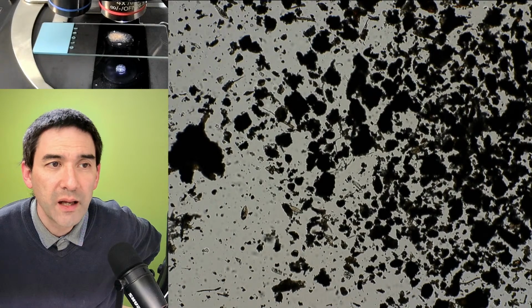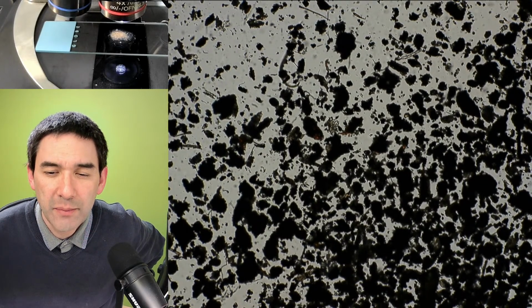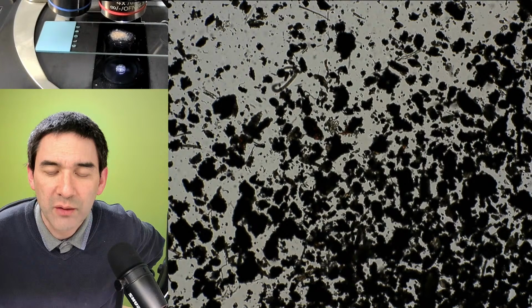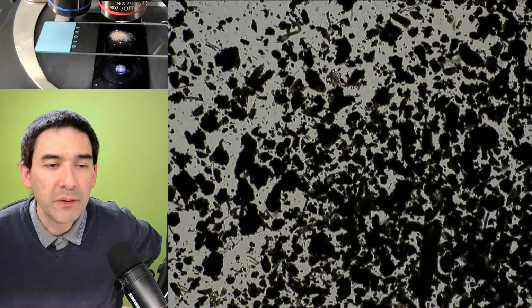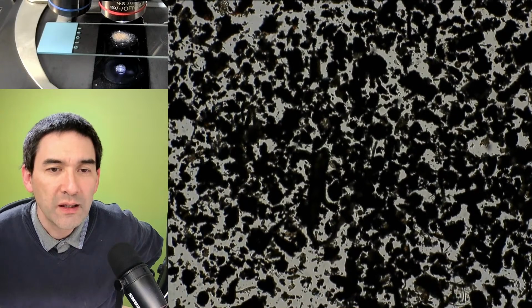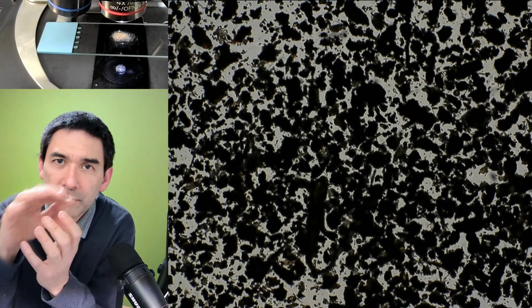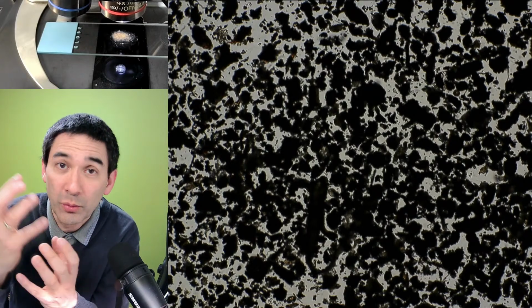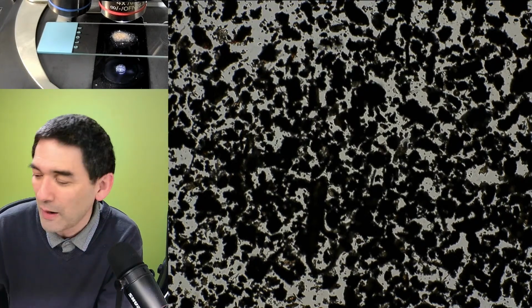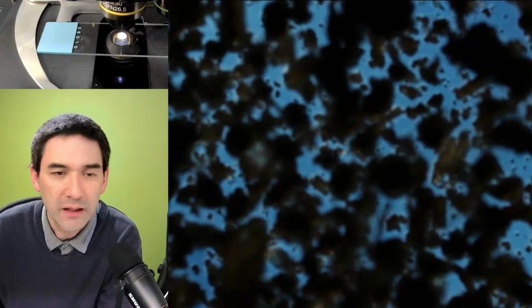And usually if you do some kind of a time-lapse video, then you're able, as I understand, a Baermann funnel is used for soil samples, where the sample is slightly heated from above to drive organisms down into the soil and into the water. That is one possibility. I've also talked to someone before who did not heat it, but used light. They had a bright light on top of the funnel, and some of the organisms moved away deeper into the soil or away from the moss, and then they moved downwards, reached the water, and fell down, right? So they got trapped this way. So you can see the whole range of different variations here. It does not have to be heat alone, it can be also different things.